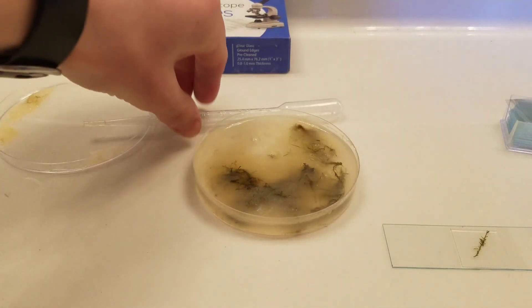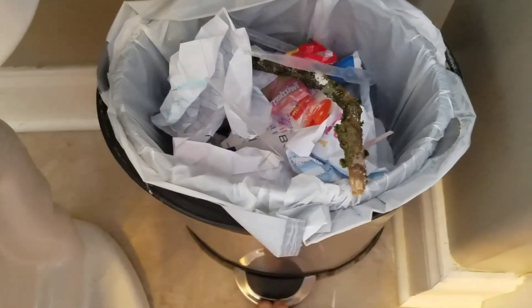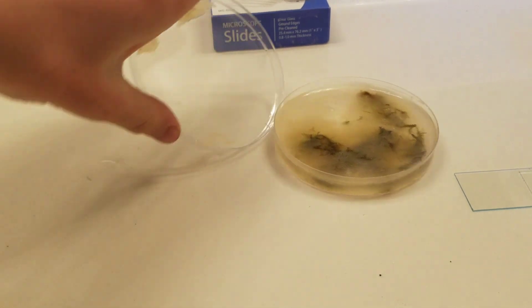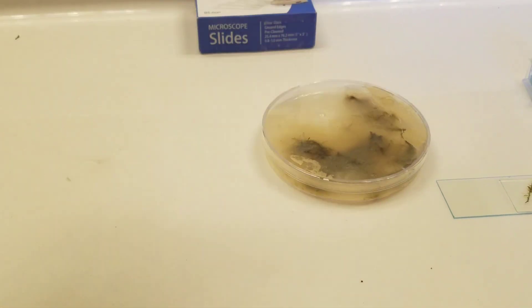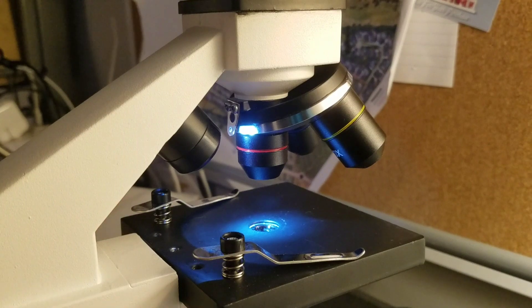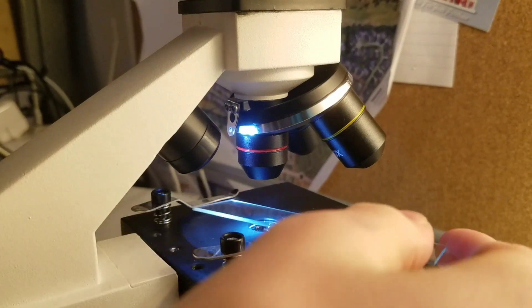So I'm going to throw all the stuff away — it's just garbage and it smells really bad. So if you ever do this, just be warned, it smells awful. I'm going to put it on the microscope and here's what I saw.